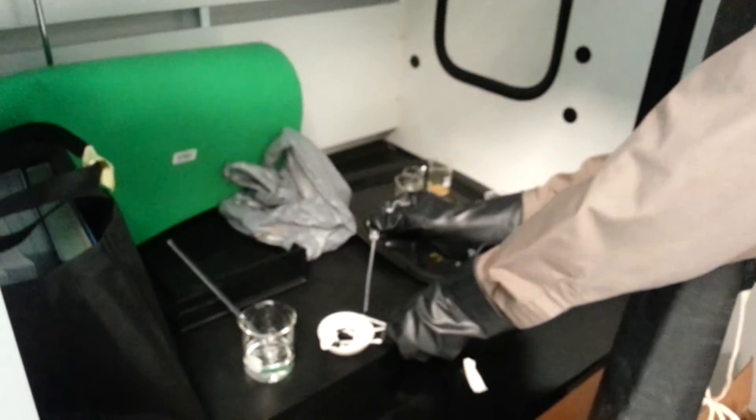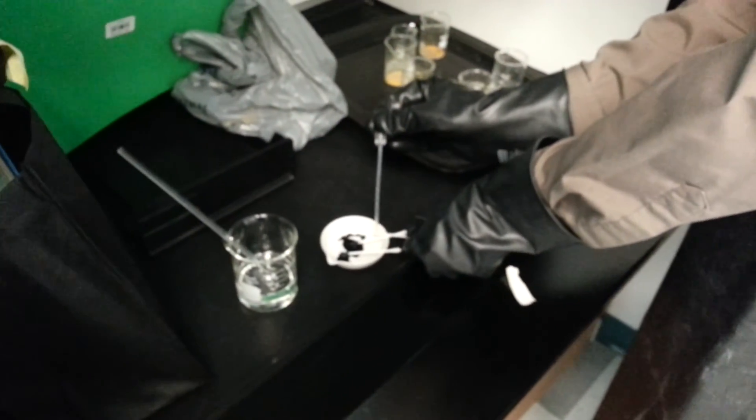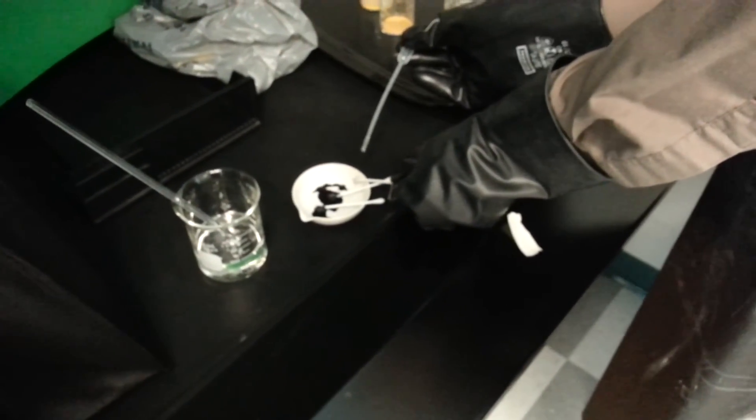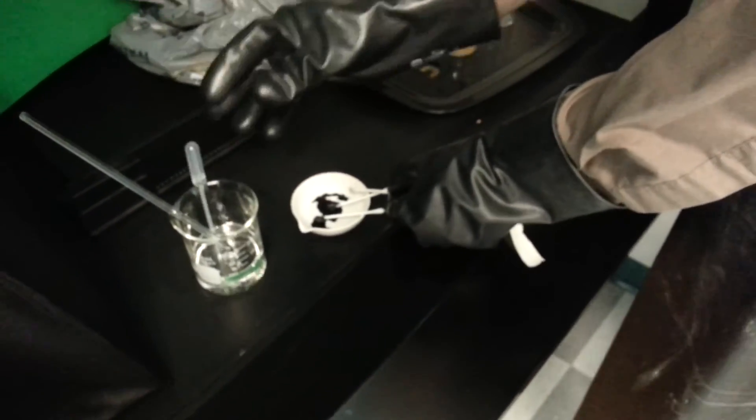Sulfuric acid. I'm going to place it on top because it's kind of covered there. And you can see that it doesn't make a color change. It's not a dark black anymore. So obviously water does not have gunpowder residue.